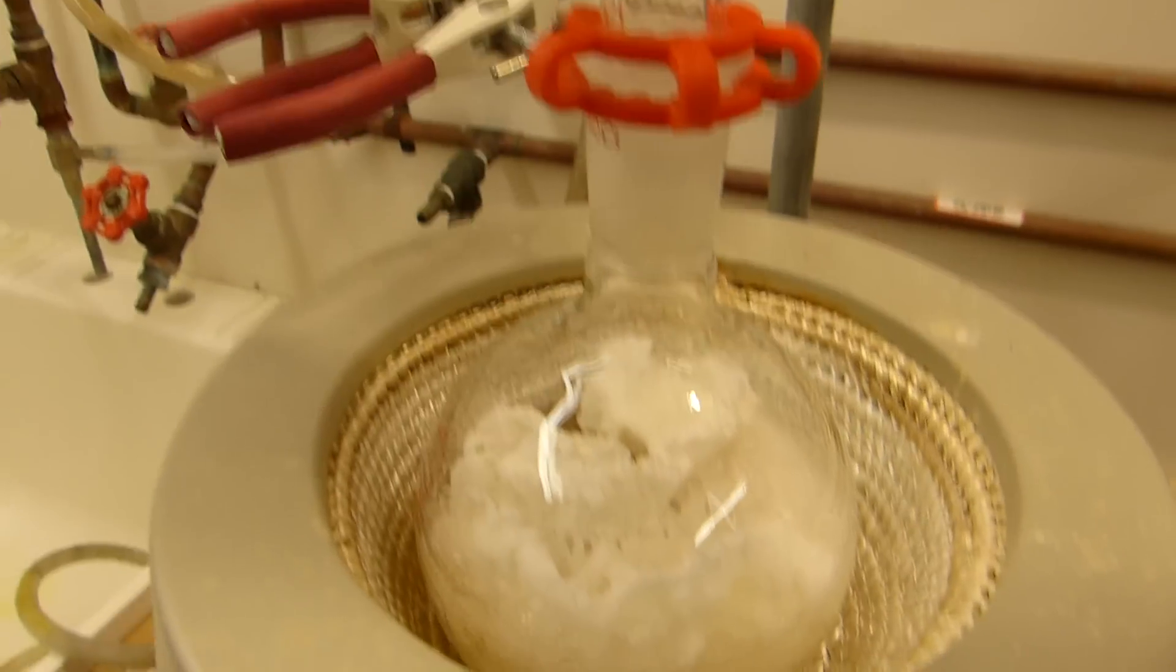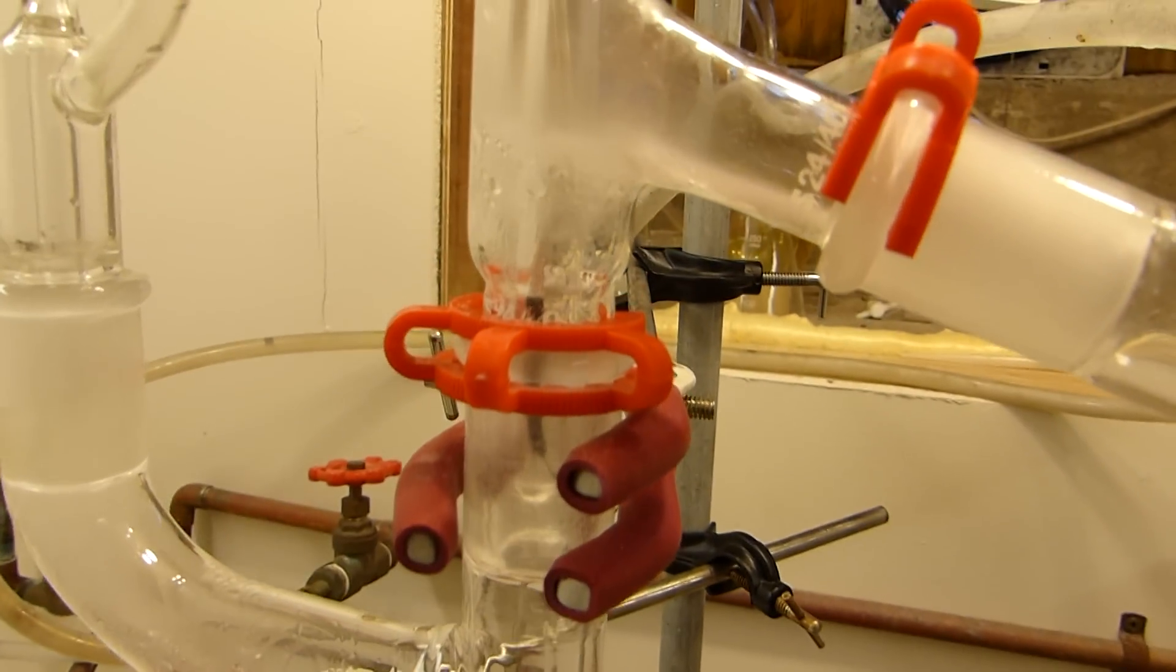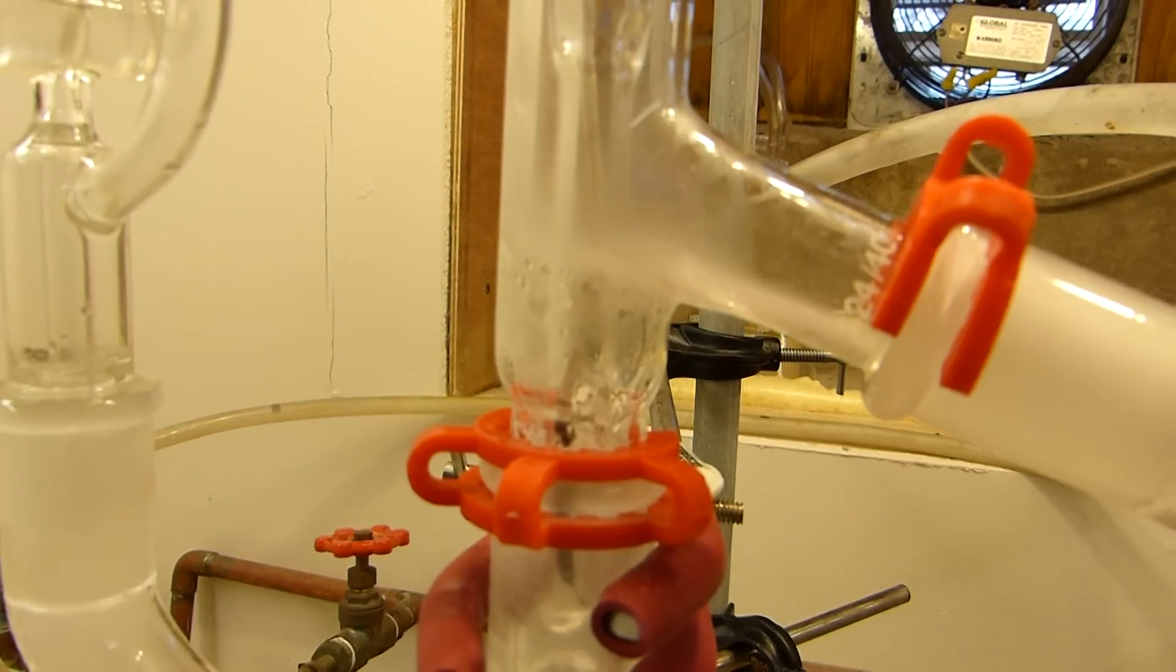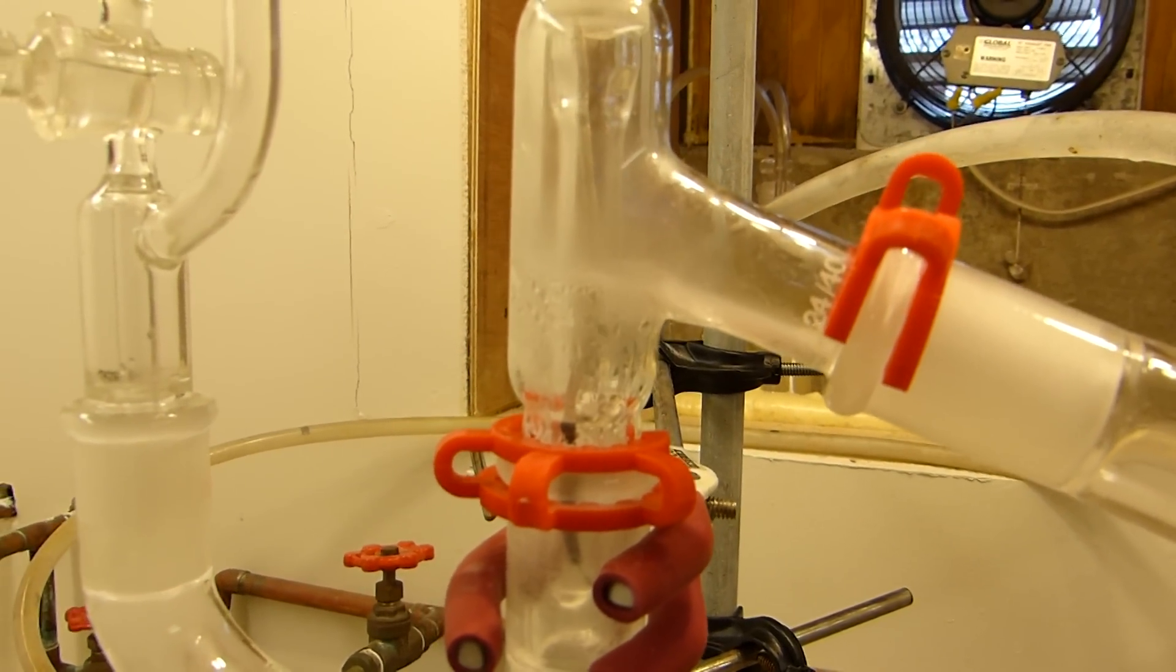The mixture is now boiling, and you can see there's a bit of reflux happening up here. And the first vapors are just now about to reach the condenser, and pretty soon acetic acid will start to collect in the receiver.